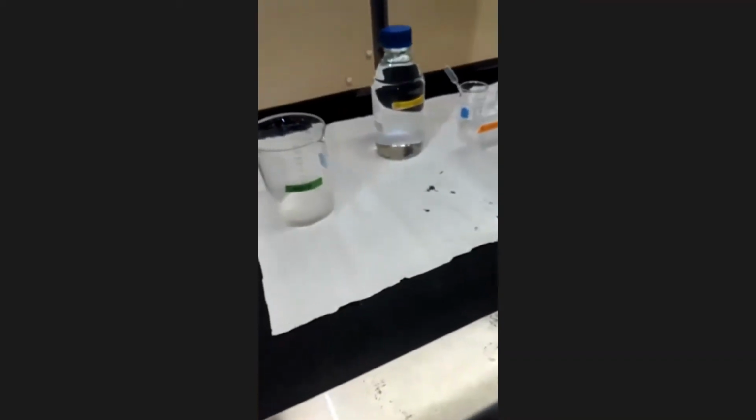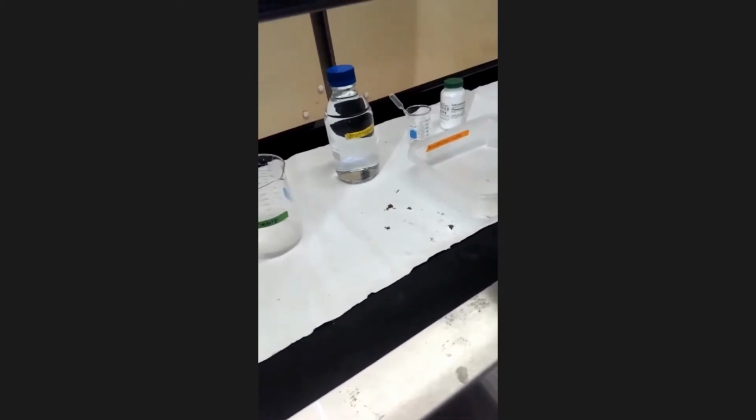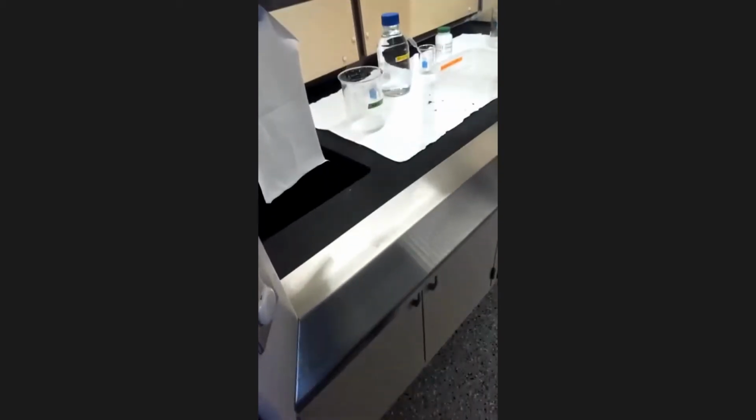Here under the hood, we have our reaction buffer. So that's where I'm going to get the buffer from, and I'm about to fill it up into the test tubes. So I'll set up the camera just here, so you get a view there under the hood, while I bring my test tube rack over and use a pipette to fill up each tube with the appropriate amount of buffer, which will be 4 milliliters.